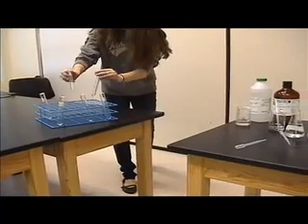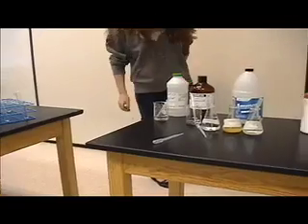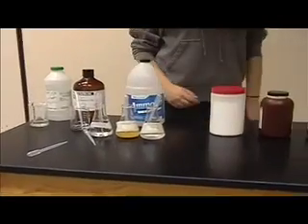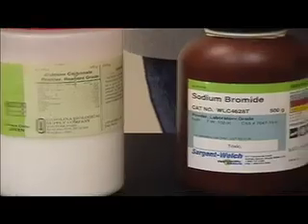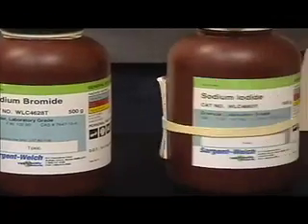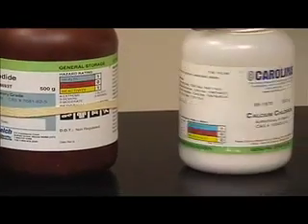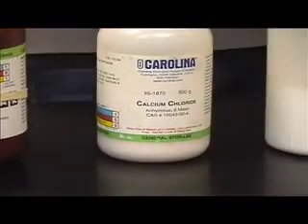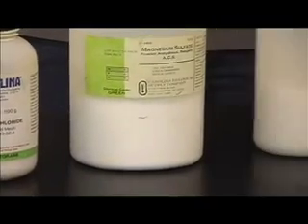So as I said before, we're going to be testing for six different anions. Let's see what they are. Come over here. The first one we're going to be testing for is carbonate. The next one we're going to be testing is bromide. The next one is going to be iodide. The next one is going to be chloride. Next one is going to be sulfate. And lastly, nitrate.